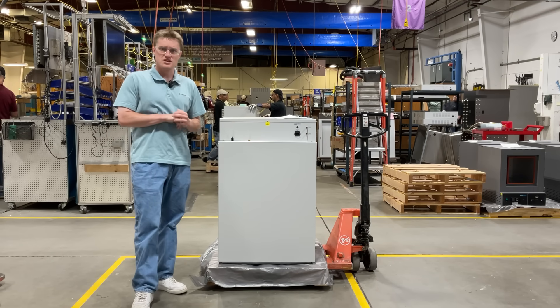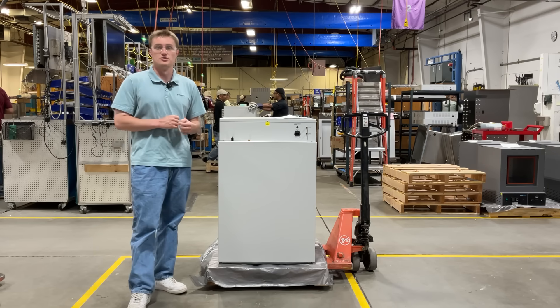For further details related to electrical safety, as well as clearances around the unit, please visit your user manual.